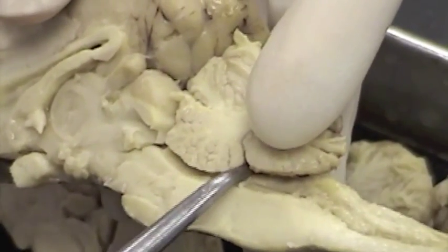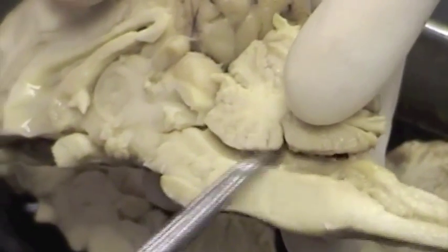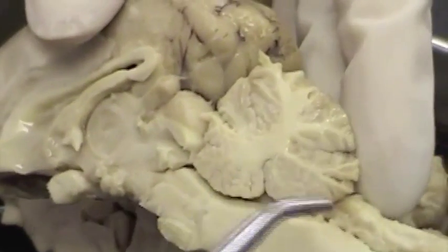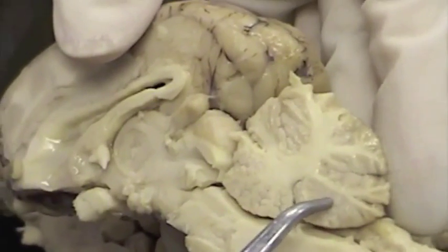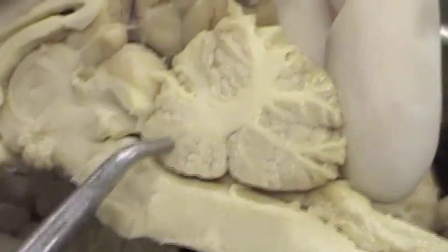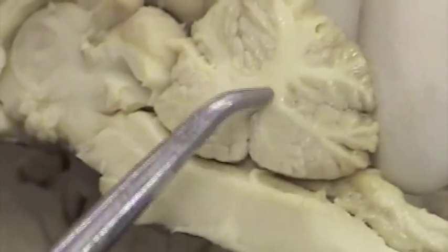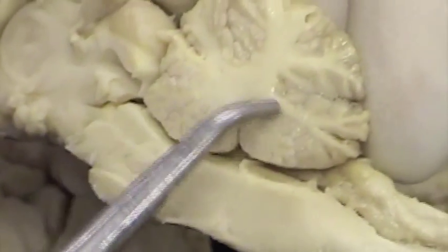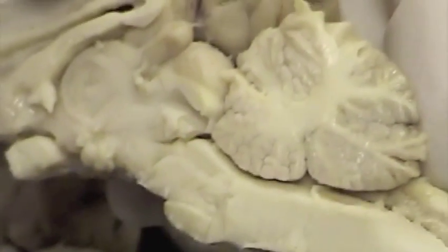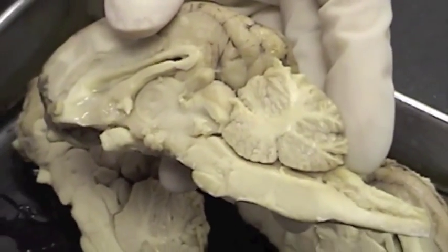Between the cerebellum and the medulla and pons is a cavity, and that is the fourth ventricle. The gray matter is this region here that appears darker, brownish, and the white matter is this region that appears lighter. The white matter contains all the myelinated fibers or tracts here. And I think that completes our sheep brain.